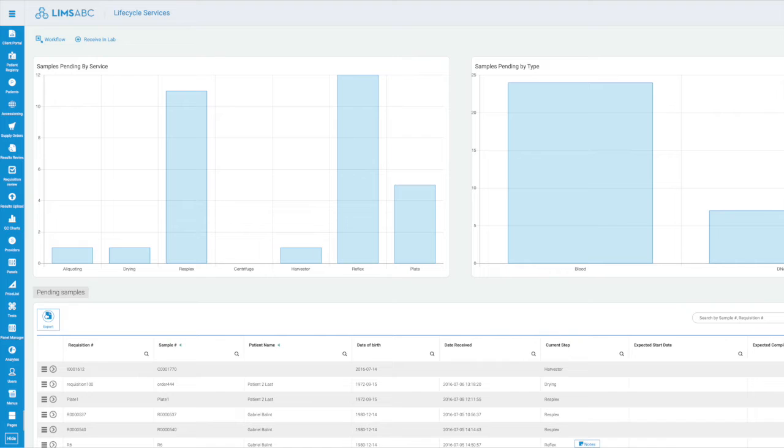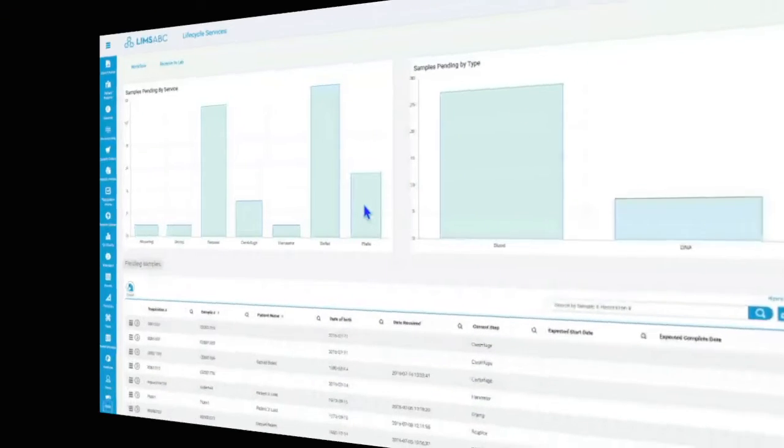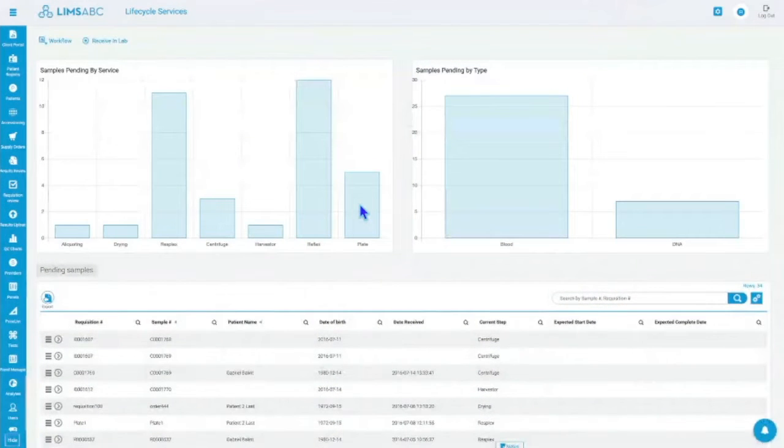When it comes to QCs, there are two parts, right? There is the configuration, and then there are the actual results coming in. I'm gonna talk about what happens when the results come in. The configuration is just setting up the limits and the ranges and so on. And we can talk about that as well, but that would be also very clear once we look at the results and how QCs can be reviewed.